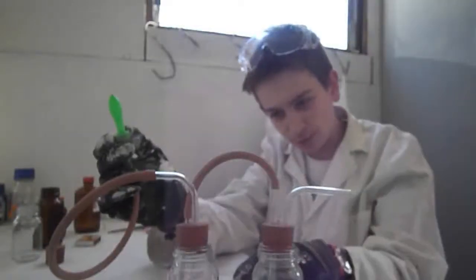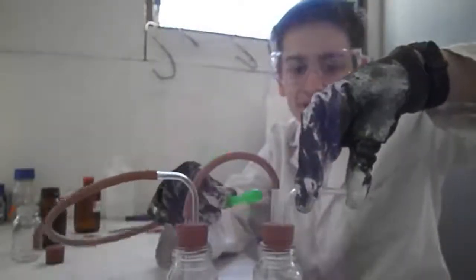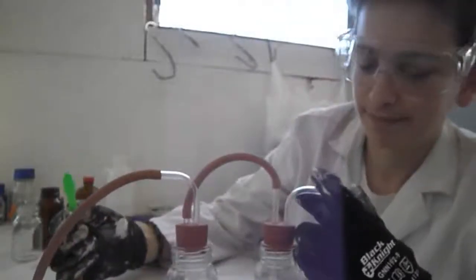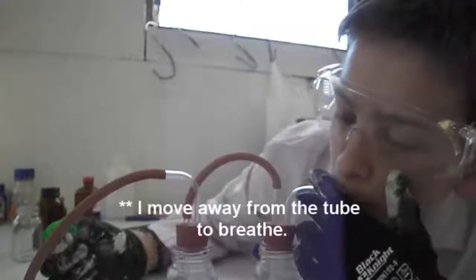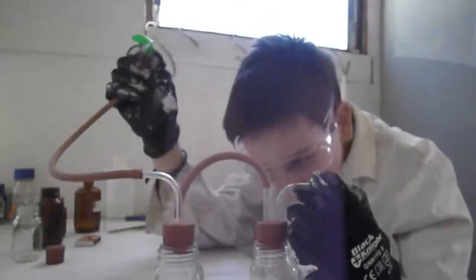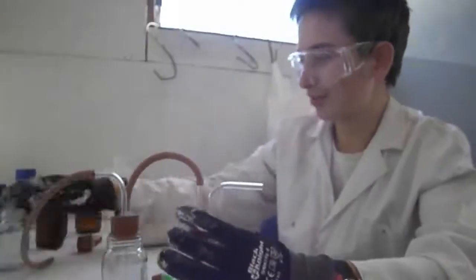There's some kind of gas forming in there. I should put these on. Alright, that's the mistake. It's coming back out that way. Okay. There's got to be one mistake. I don't want to breathe in hydrogen gas. The zinc just totally went into oblivion. Probably, yep, just totally ruined it.